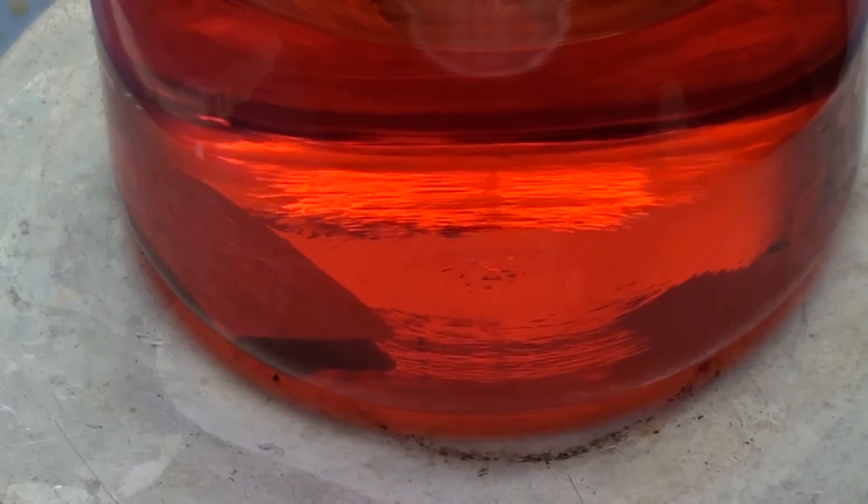Okay, we're approaching the 11th hour of our second day. And while the platinum is considerably thinner we're still not done. I'm going to turn this off and come back tomorrow.